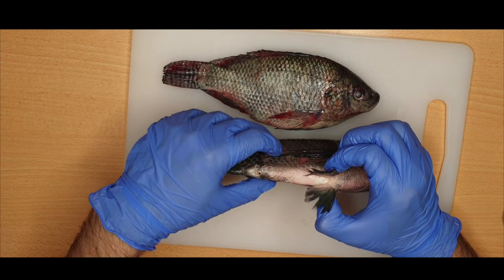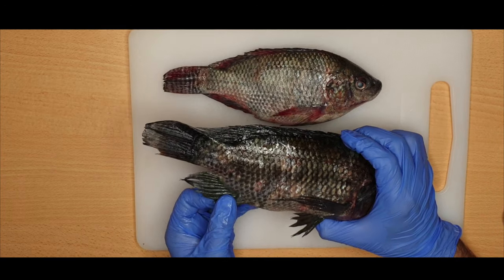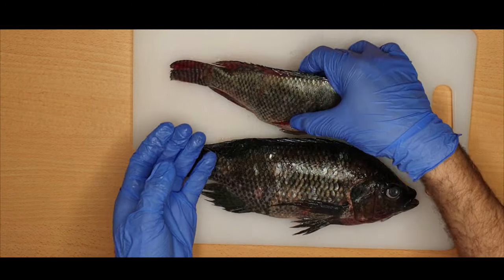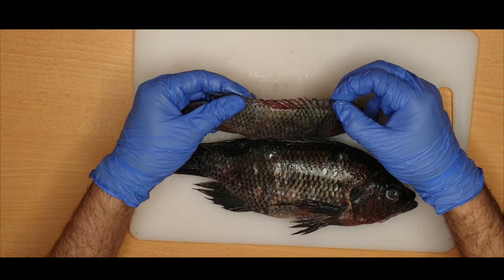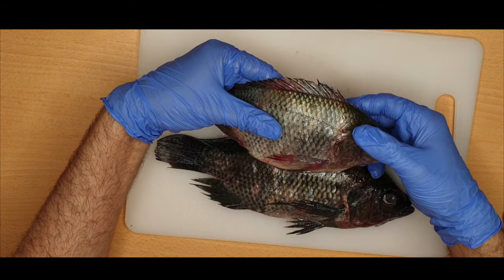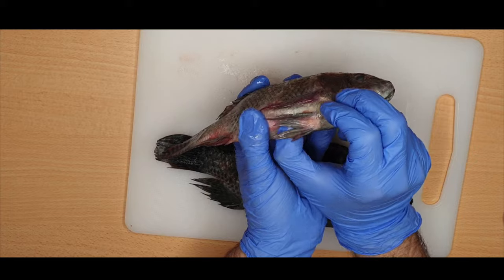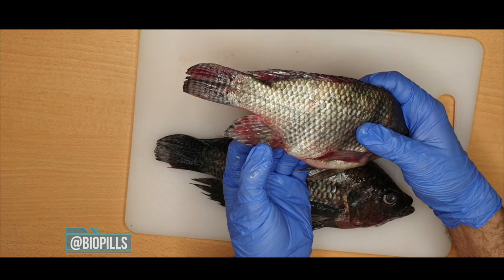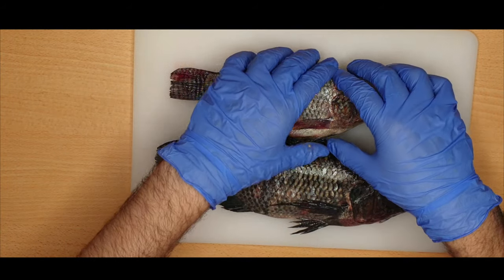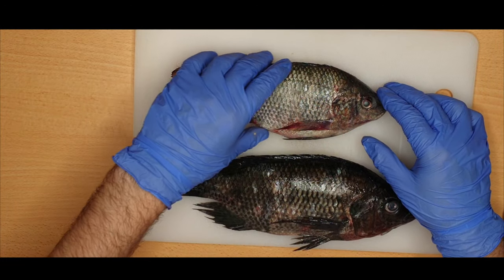Here we have the pelvic fins — a pair of pelvic fins located at the pelvis bone. Here we have the anal fin, right after the anus. And eventually we have the caudal or tail fin. So to summarize, we have the dorsal fin with bony and soft portions, the paired pectoral fins, the paired pelvic fins, the anal fin, and the caudal fin.